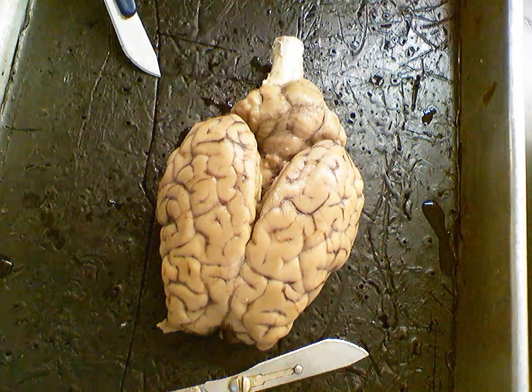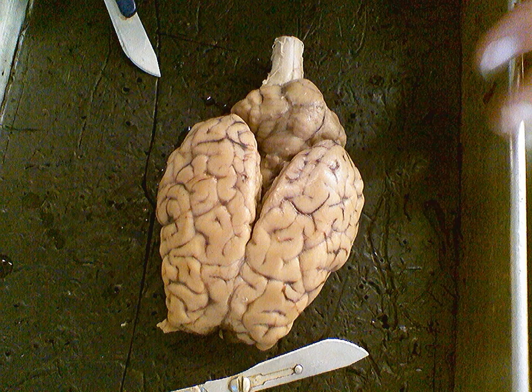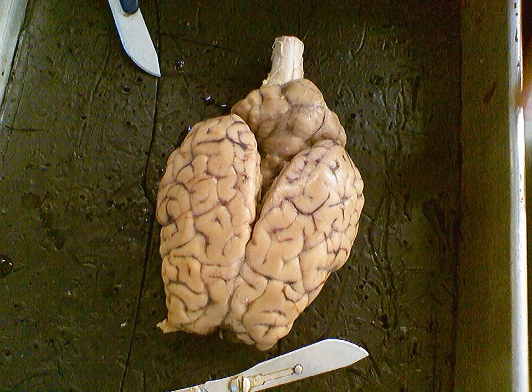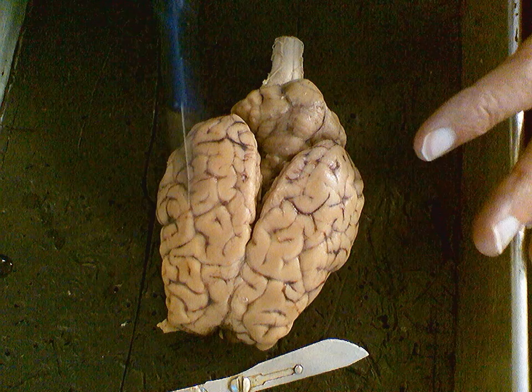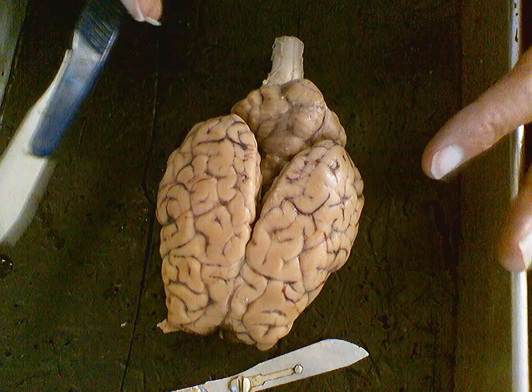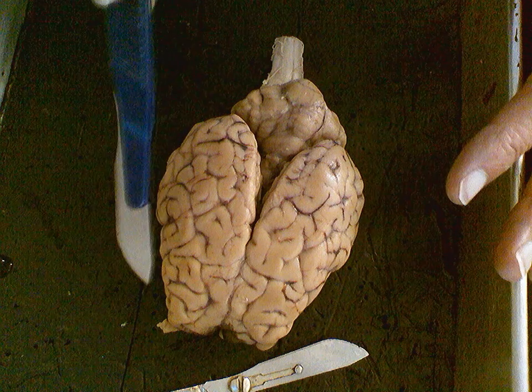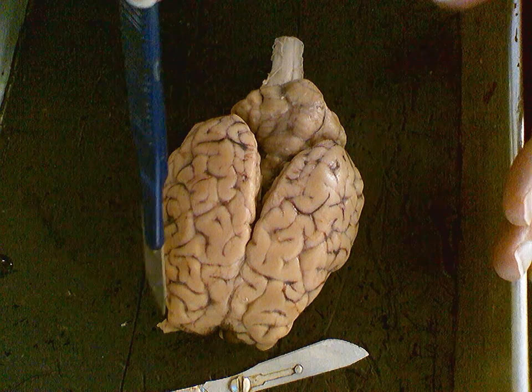Anatomy, take 1. We are looking at the dorsal side of the sheep brain, and we are about to walk through some of the major regions, structures, and orientation areas. So we already said this is the dorsal view, or the dorsal side of the sheep brain. We can take a look at the major structures we see here on the dorsal side, but first let's review some of the positions, the terminology associated with position.